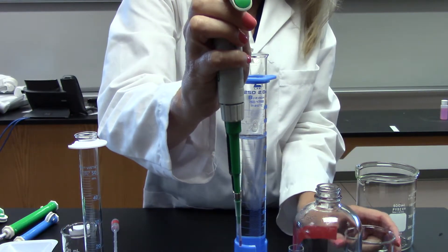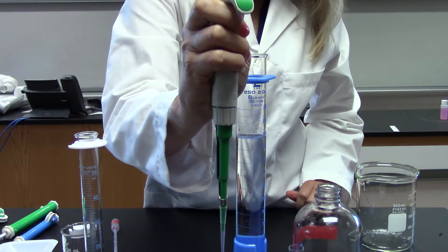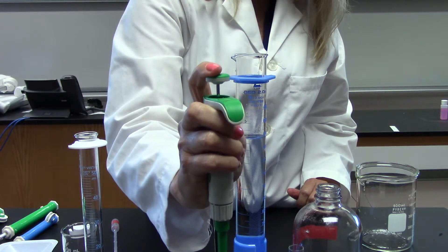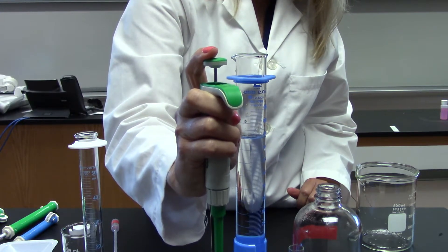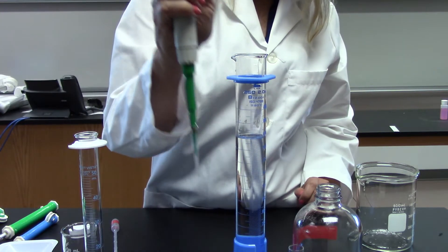Then to dispense this, all I do is push halfway again and it will dispense that liquid. I wouldn't want to dispense with the tip down in, because then when I let go, it's just going to suck that liquid back up again. So very, very accurate, the micropipette.